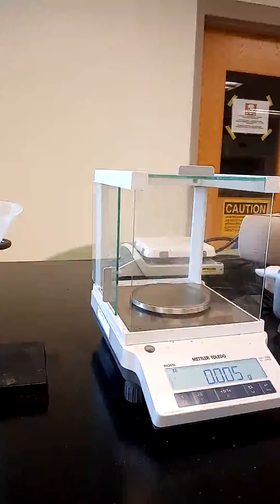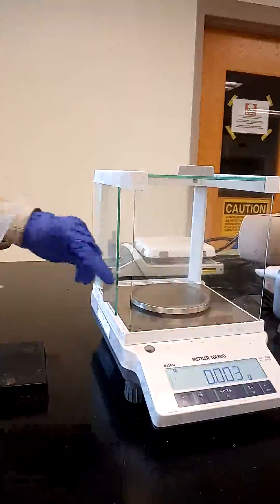So we start with today's lab, separation of the components of a binary mixture. We begin by taking this clean, dry weighing dish and obtaining its mass.